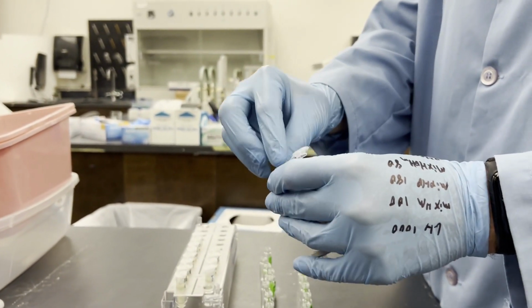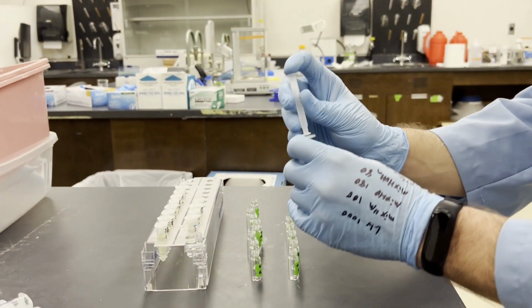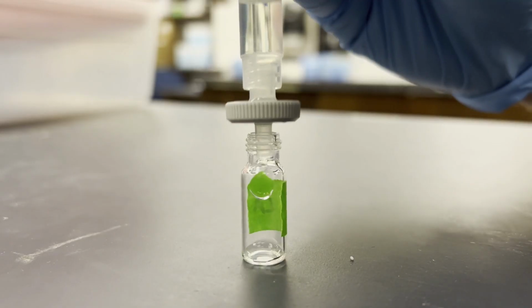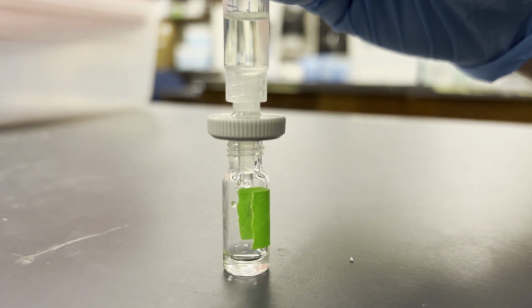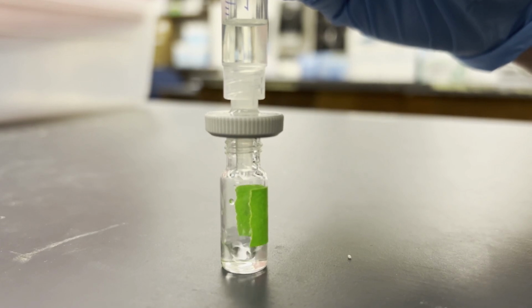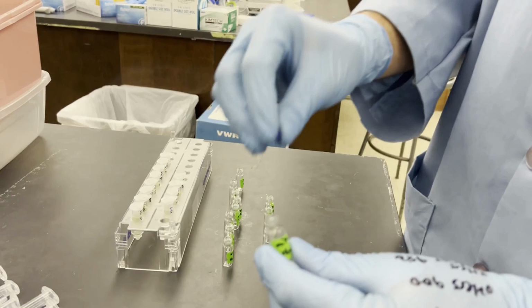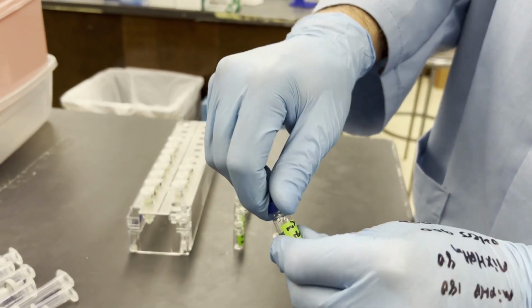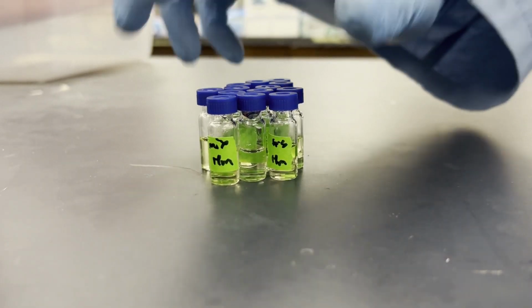We don't want any undissolved particulate getting into the HPLC column, so we will filter our samples with the syringe, adding slowly to make sure the pressure doesn't burst the small filters. Make sure you're in position once you begin placing the plunger back in, as the initial flow may move faster than expected. Once you've capped your HPLC vials, your samples are ready to run. Here's a good 7 hours of separation ready to run.